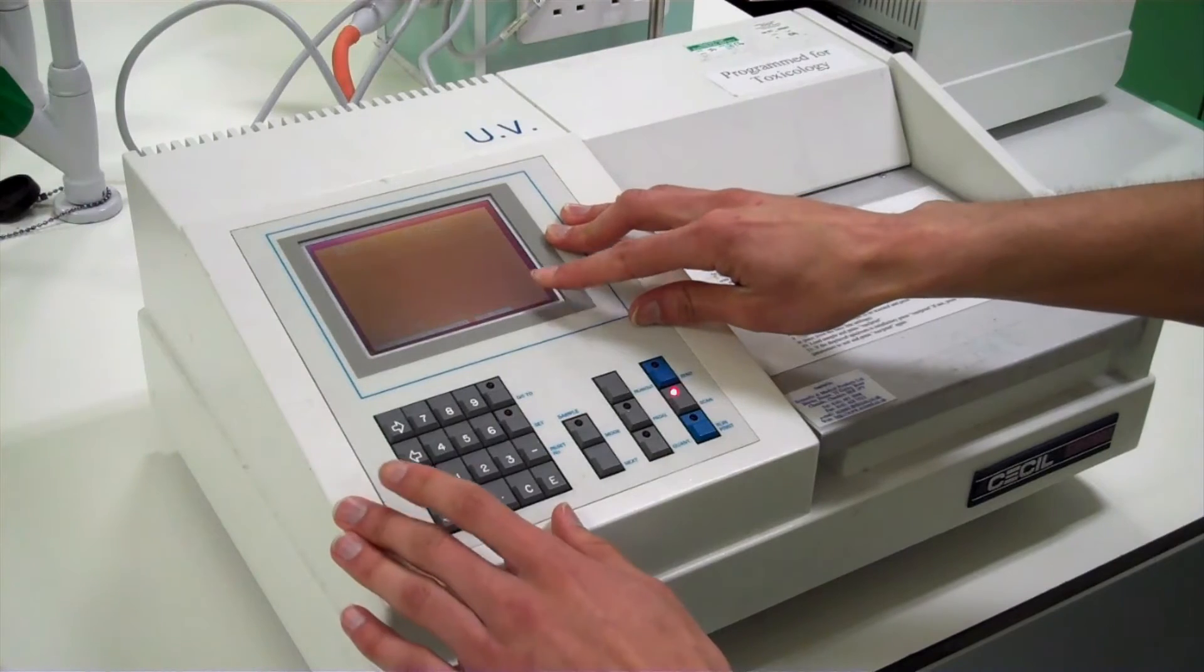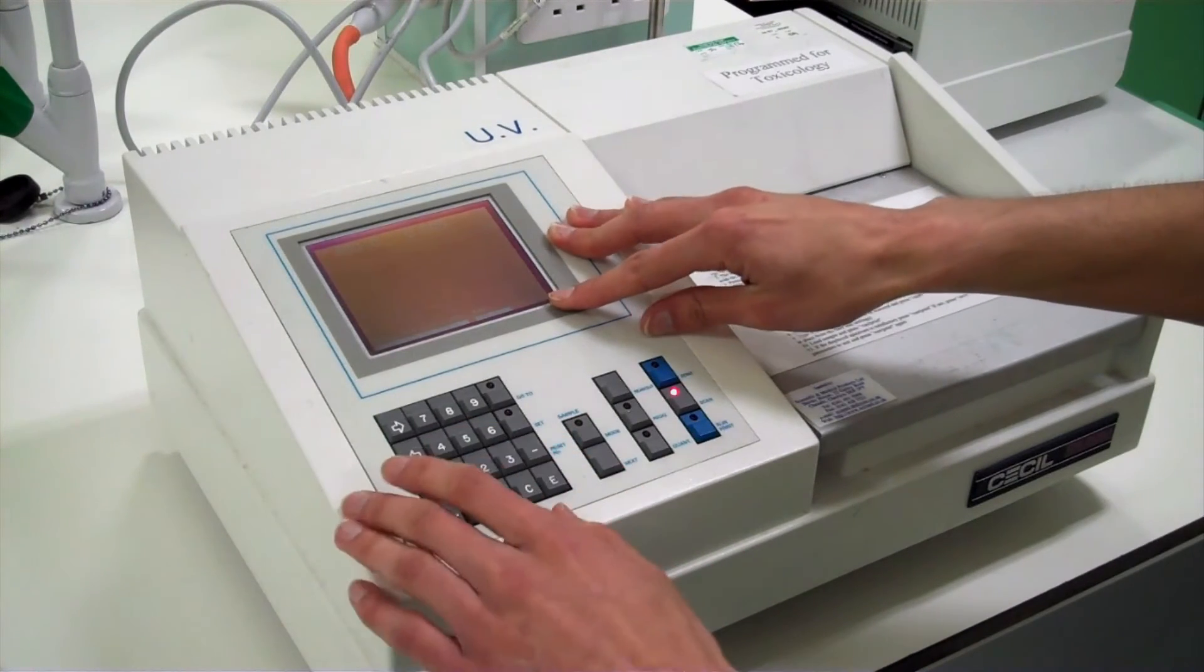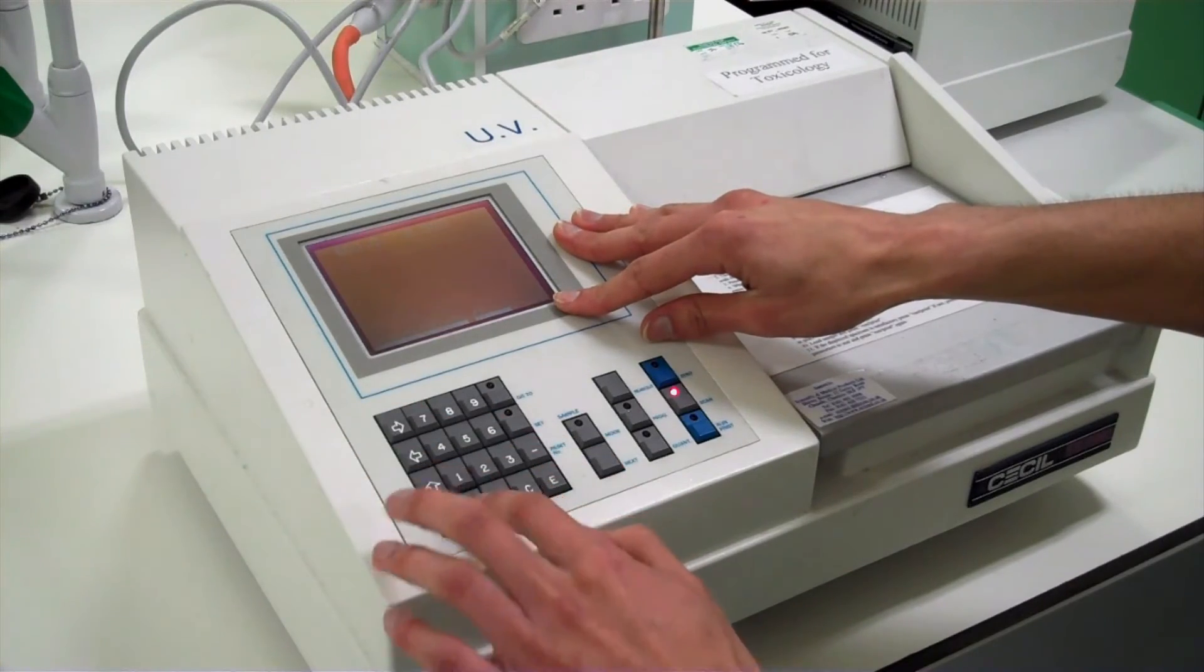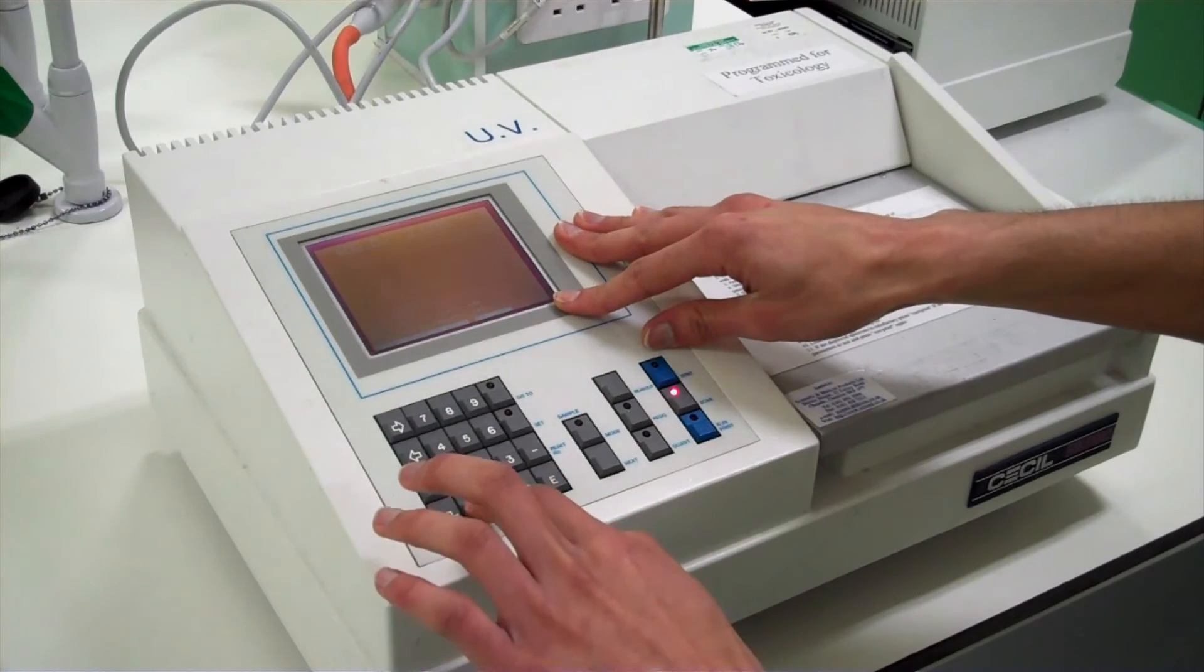The same as the blank, the start wavelength is 400 nanometers. Enter. The end wavelength is 700 nanometers. Enter. And the speed is 600 nanometers per minute.